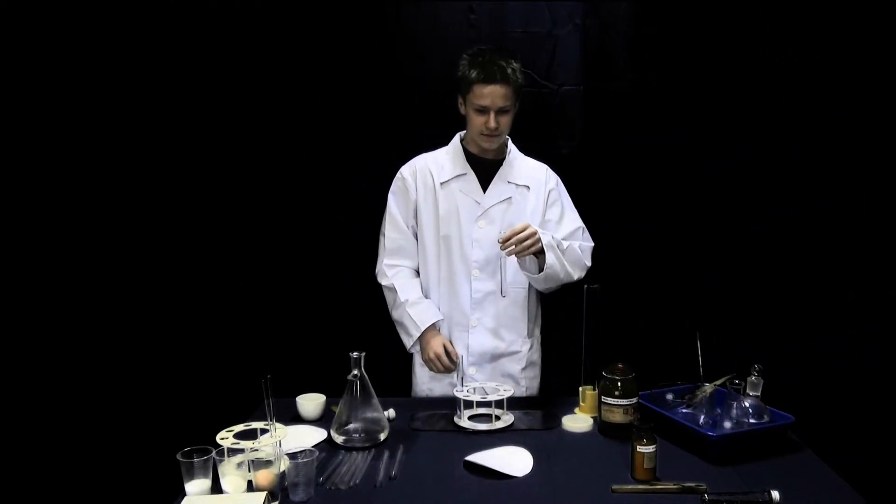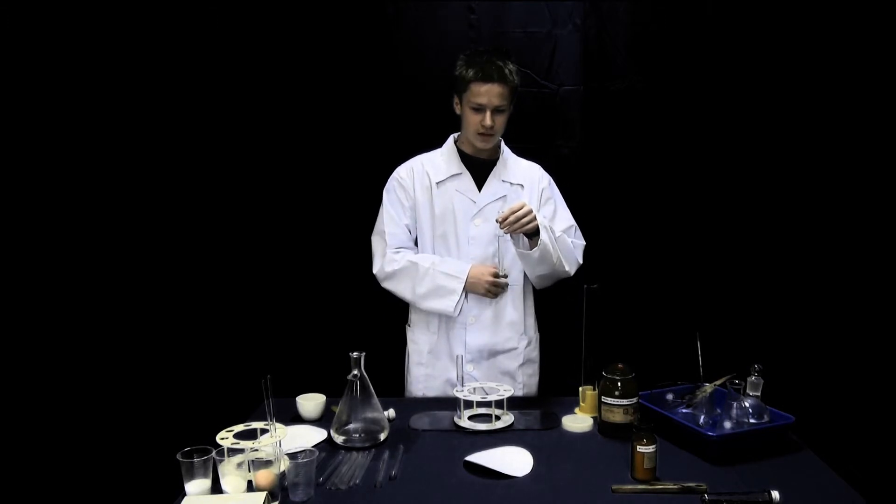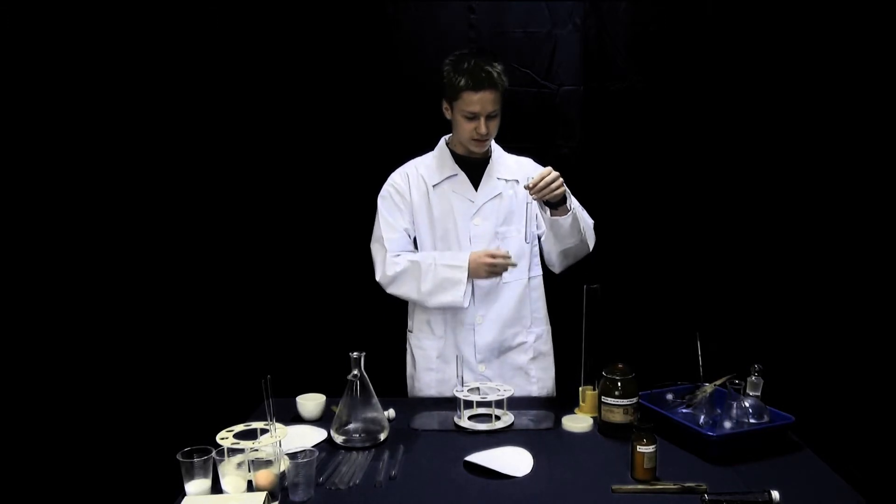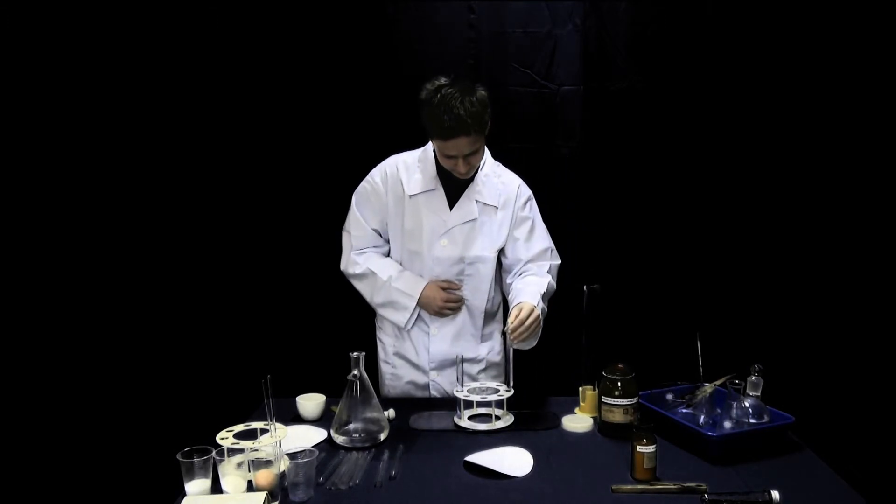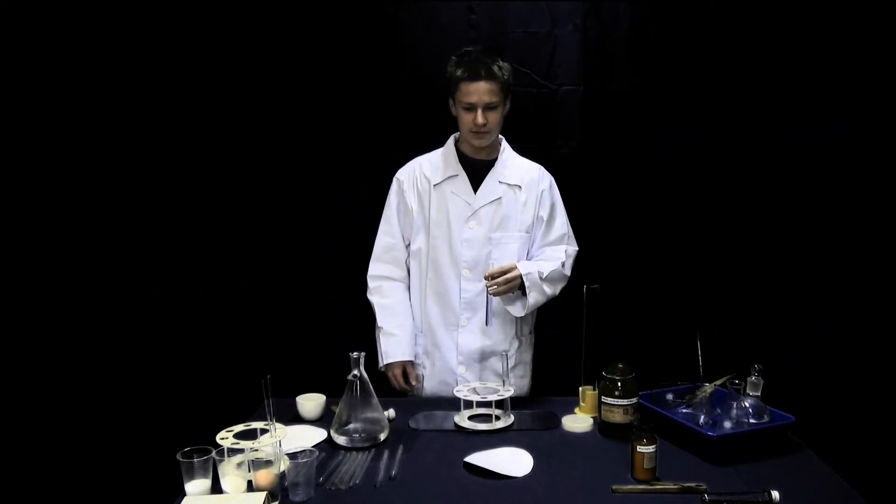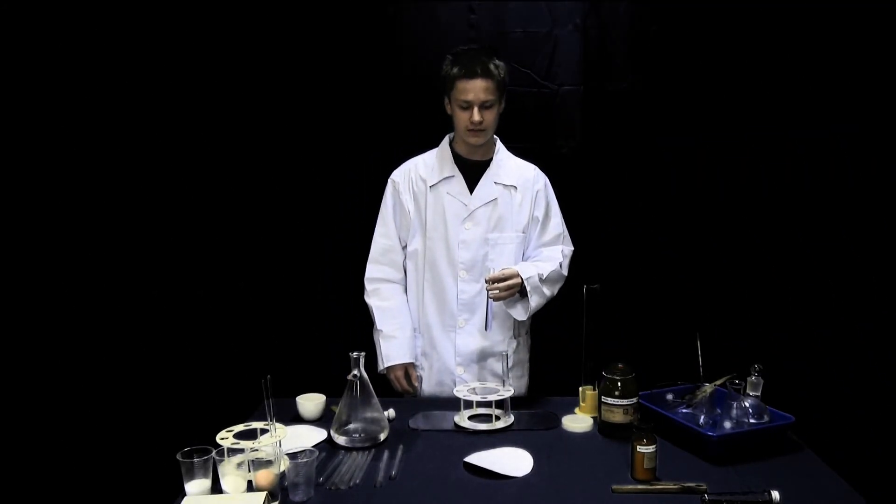Observation: In the first tube with crystal copper sulphate, it dissolved very slowly. The substance with powdered copper sulphate dissolves fast.